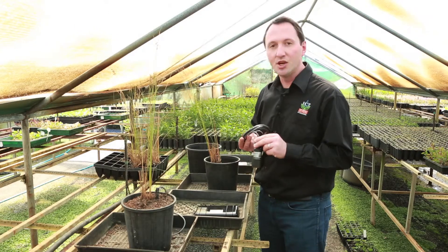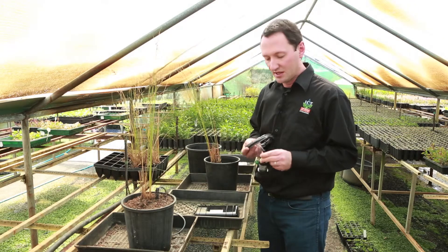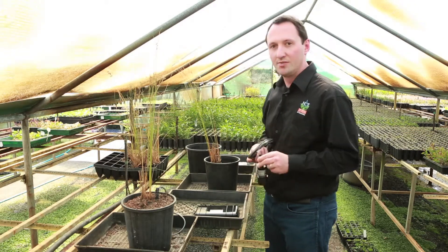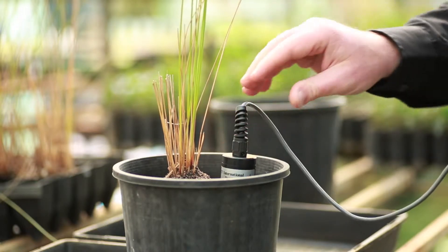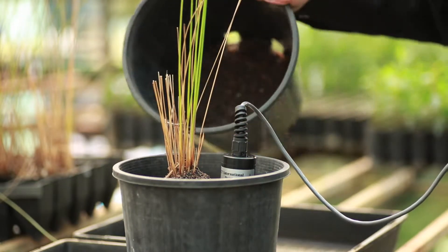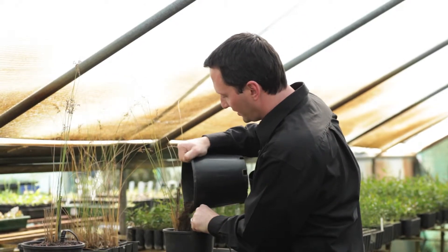The ICTO2 sensor does have temperature compensation so it helps in this regard. To install the sensor in soil, make sure it is going face down like this. Then just backfill your soil around the sensor and your plant of interest.